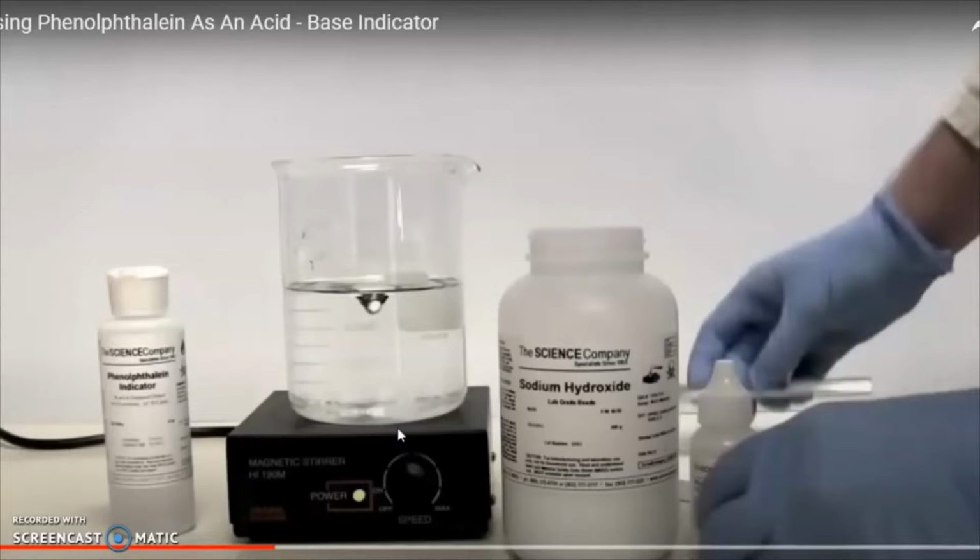I'm going to show you just a couple. This particular indicator is called phenolphthalein. In the beaker right here is sodium hydroxide, which is NaOH, which is a base. And then this person is going to add some indicator called phenolphthalein. You can see the name on this little bottle over here. It's got a really weird spelling. But phenolphthalein turns pink when it's in a base. So it's clear if it's acidic or neutral, but it's pink in a base.